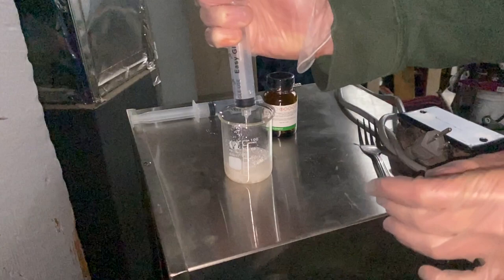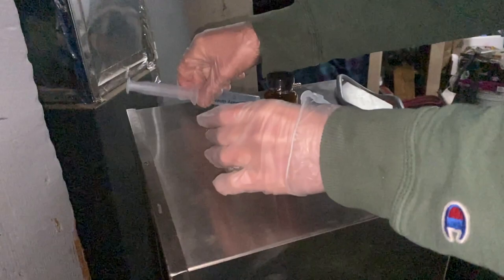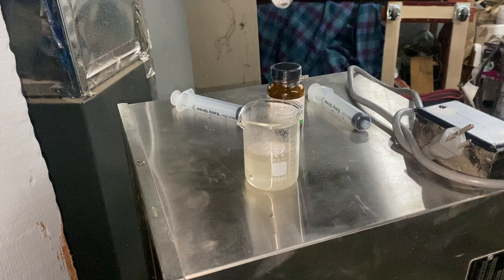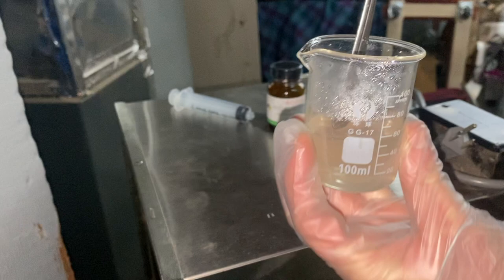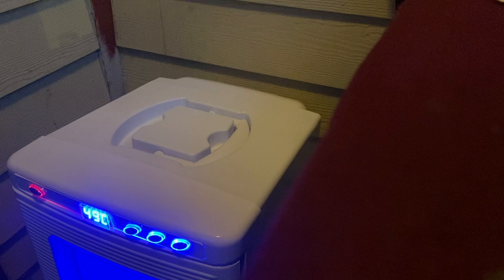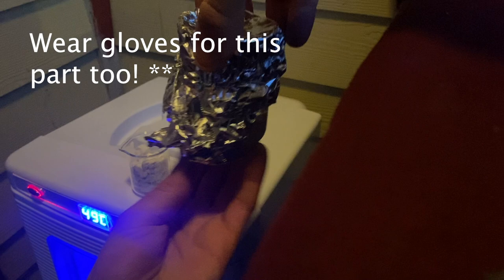This is slow-mo — I'm adding the water, and if you look closely it starts to steam. It's a very dangerous chemical. Stir it up carefully. Going forward, it's worth thinking about how we can recreate silk just from the silk fibroin itself. Remember to wear gloves — I forgot at this point. I poured the lithium bromide solution in over the silk, having covered it with foil to prevent steaming while bringing it outside.